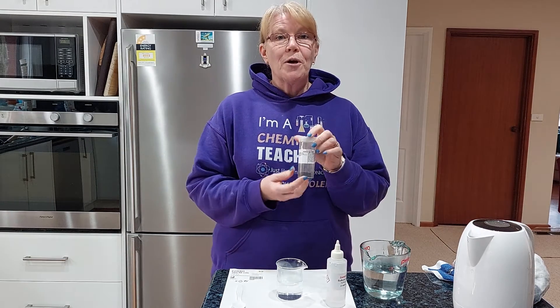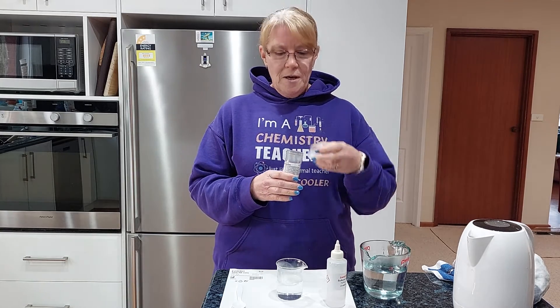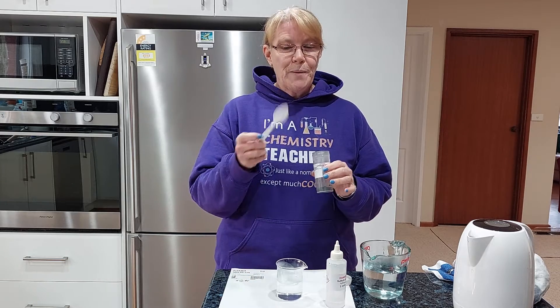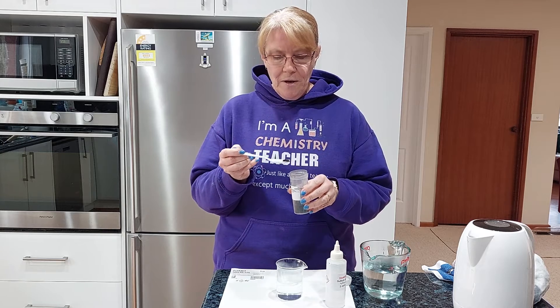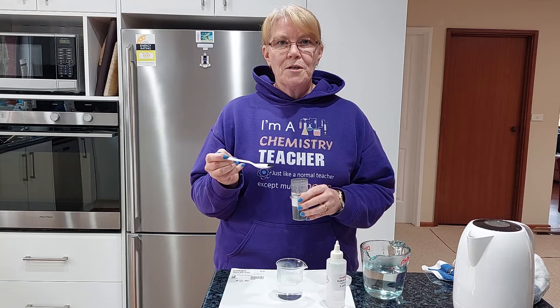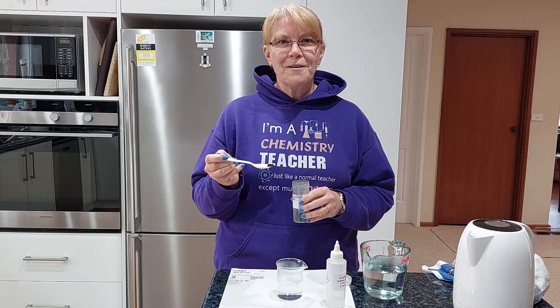I'm going to take my copper oxide — this is a black powder — and I'm going to get my spatula and just get a bit of the black powder onto that spatula. Then I'm going to put it into the sulfuric acid, stir it up, and we're going to watch the magic happen.